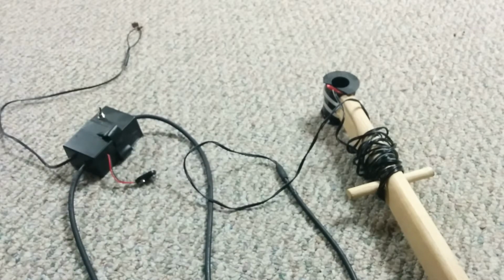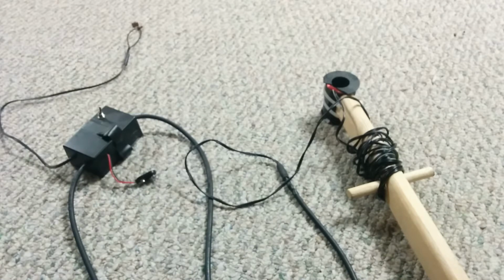So, welcome back to the lab where I've got my NMR receiver sprawled out on the floor here, and I intend to explain a little bit more about the details of how this thing operates. Now, there's been a lot of viewer interest in this stuff. A number of people have written to me with questions about the details of the circuit since they are interested in conducting some NMR experiments for themselves or taking things further in a number of directions.